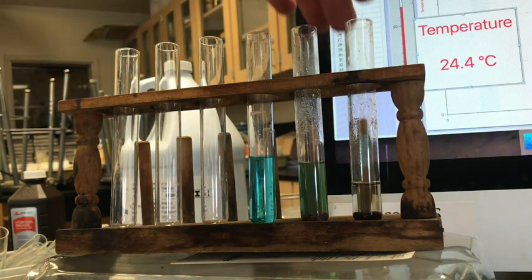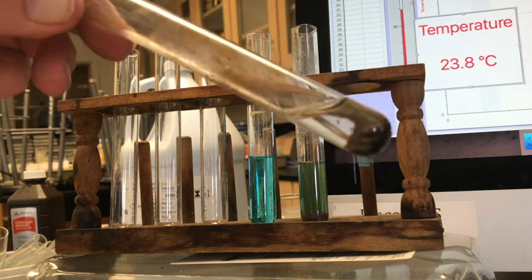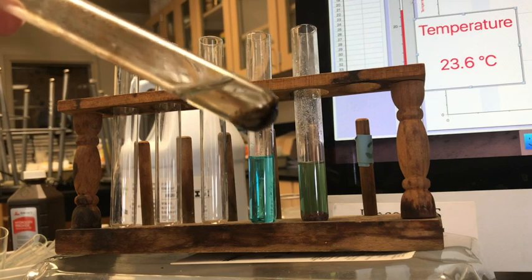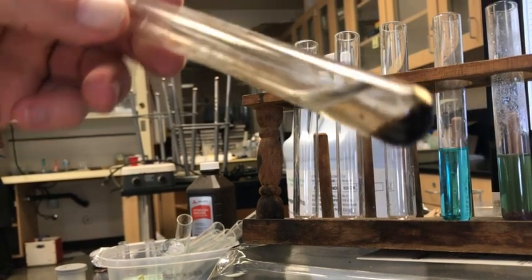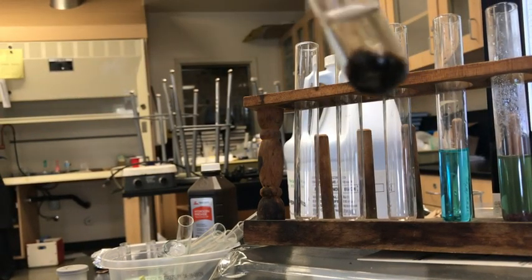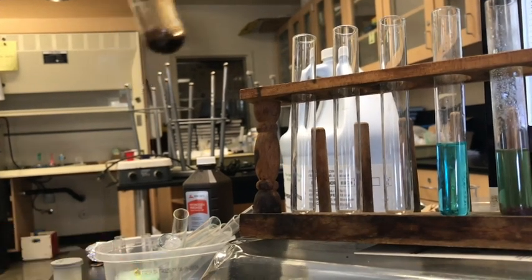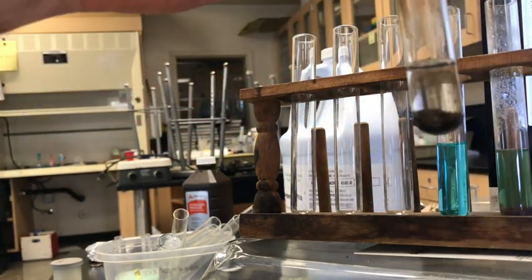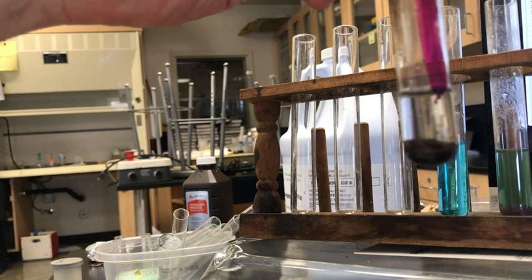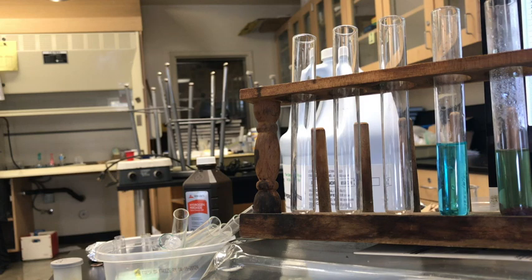Okay, let's look back at what we did. We created something a little more brown. I'm going to get away from the temperature thing so maybe we could see a little better. Something brown at the bottom, which happens to be the change that happened to the catalyst. The liquid itself now has less hydrogen peroxide in it, which means that a catalyst can no longer cause change. And the reason the catalyst can't cause change is because the reaction's all over. I don't really have any hydrogen peroxide left.